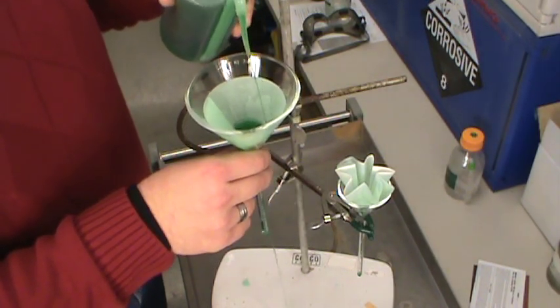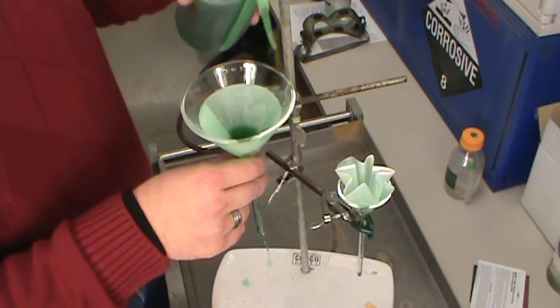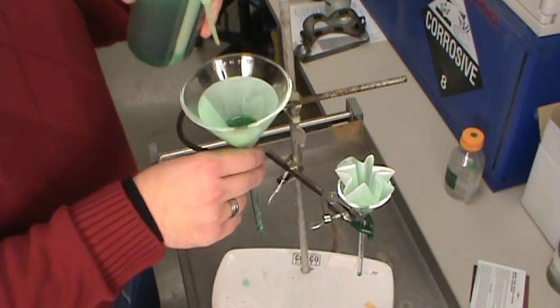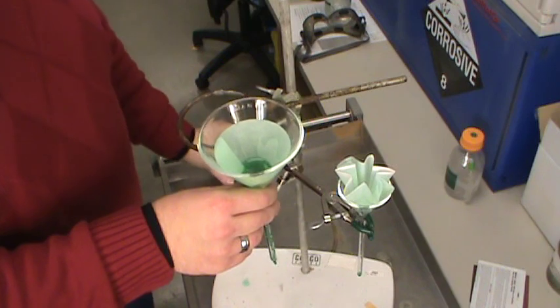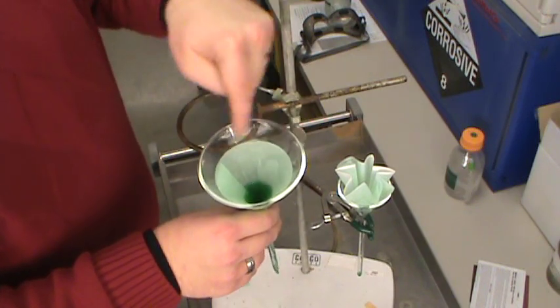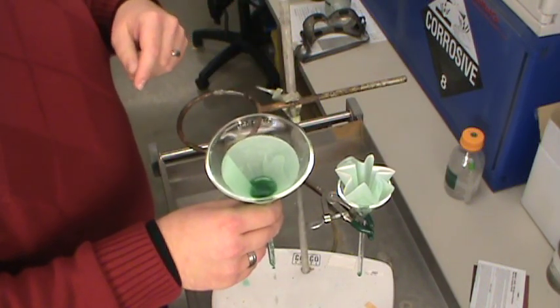So if I'm going to filter something, it's a little bit forgiving if you maybe miss a little bit, go up the side. You have a little bit better chance of not losing a whole bunch of your solid because the top edge is stuck down to the bottom of the funnel.